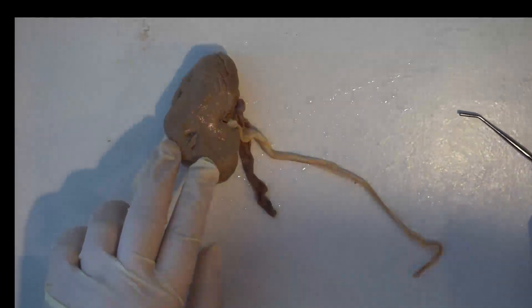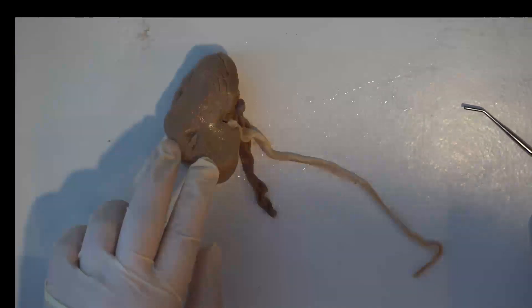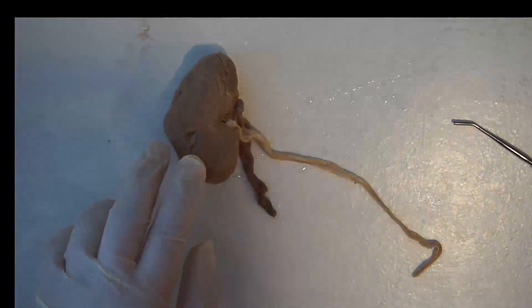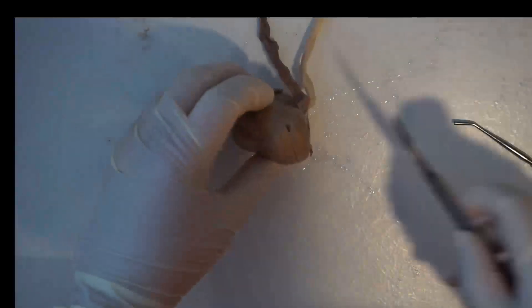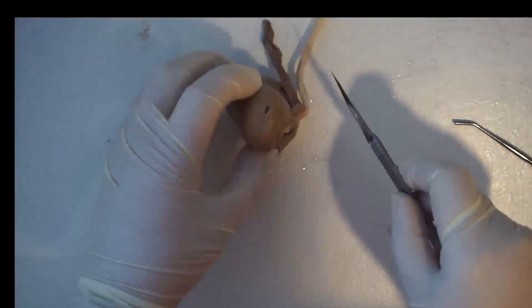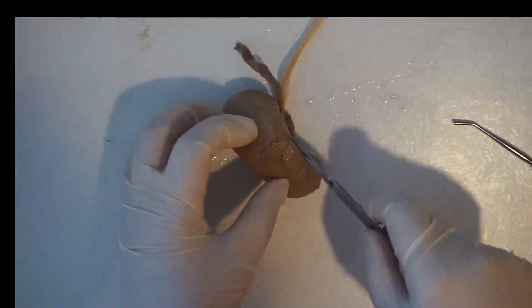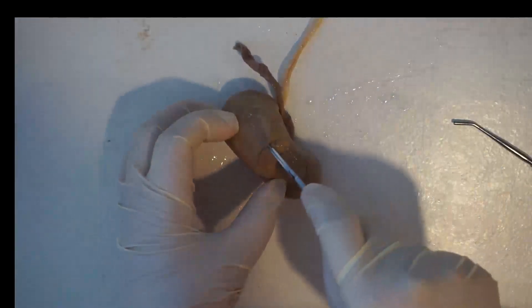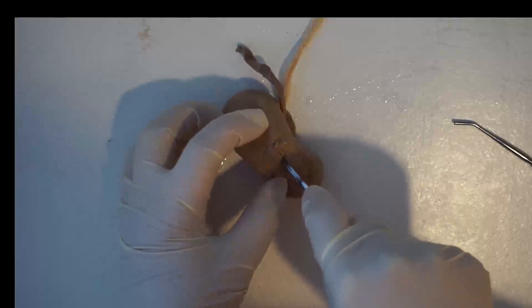Next, we're going to cut our kidney in half. It's important to try to cut it as perfectly in half as you can so you can see the most structures. Hold it on its side so that the hilum is down on the tray, and then cut straight down the middle.